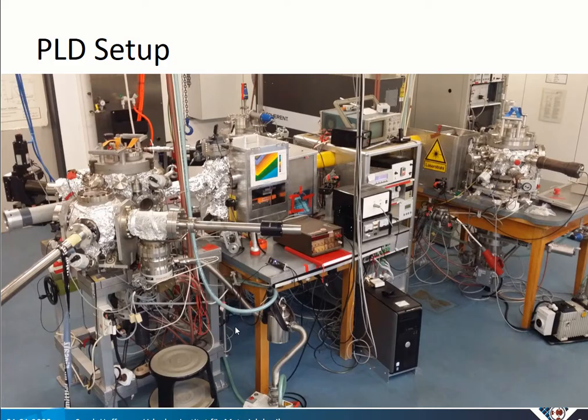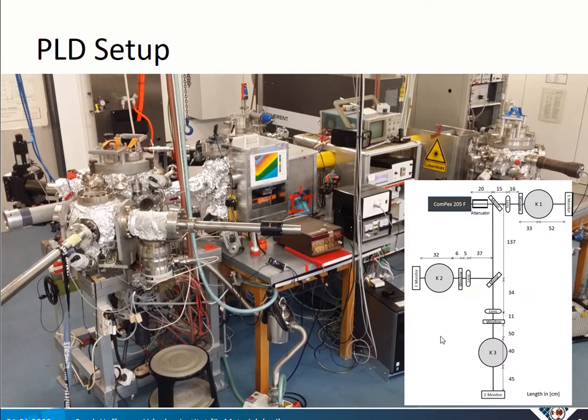The next thing where I am in charge is the PLD setup. Here we have the laser and 3 deposition chambers. From the top it looks like this. Directly behind the laser exit we have an attenuation system where we can attenuate our laser beam in many steps, from 97% through passing to 0, I would say.